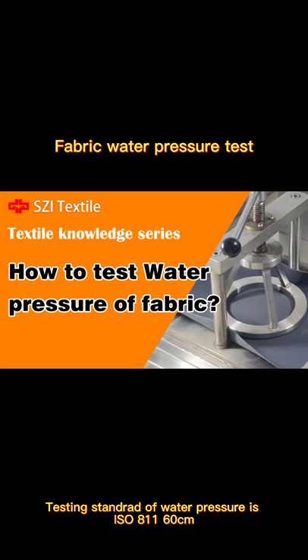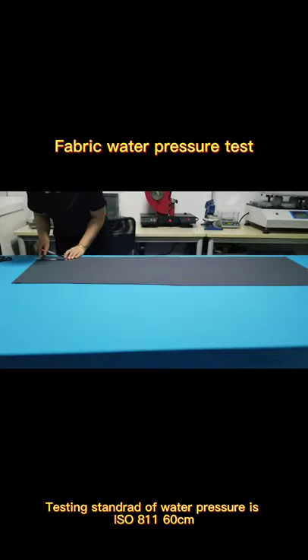Testing standard of water pressure is ISO 811 60 cm.